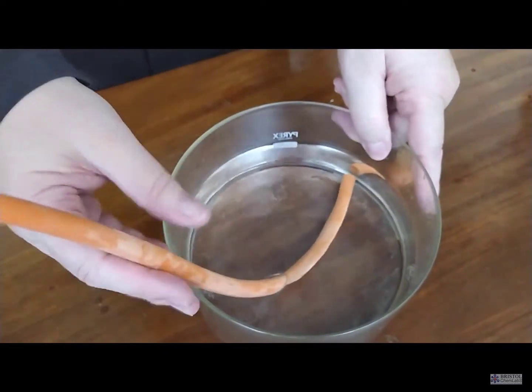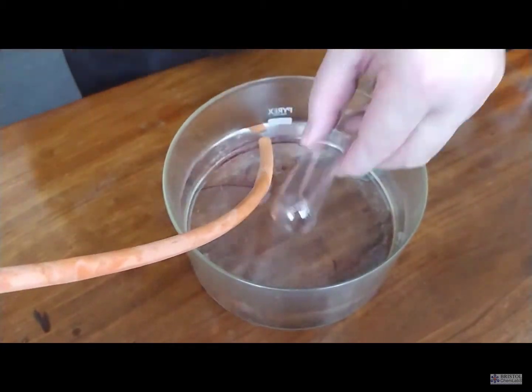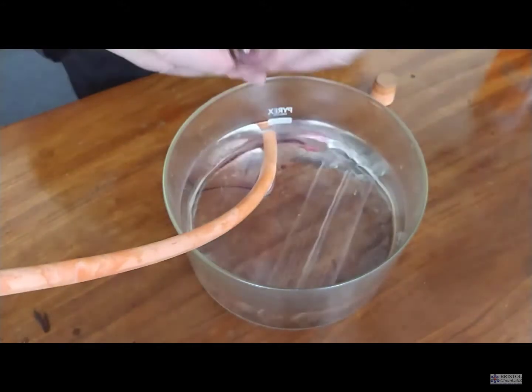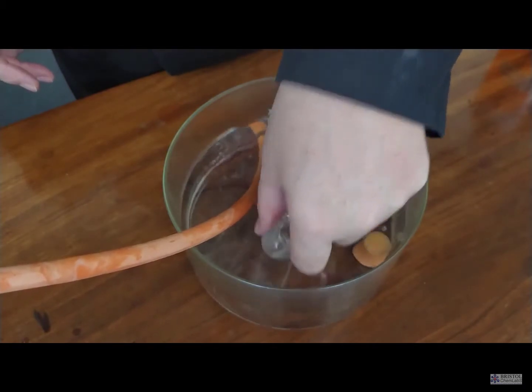You'll notice that some delivery tubes have already been placed in a trough of water, and the tubes themselves have been filled with water to collect the gas.